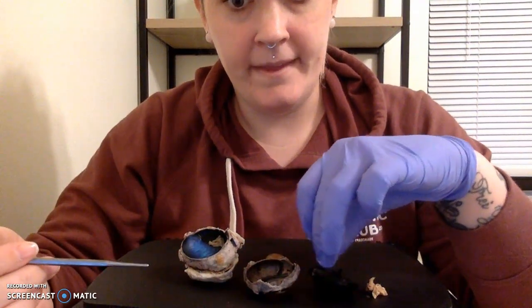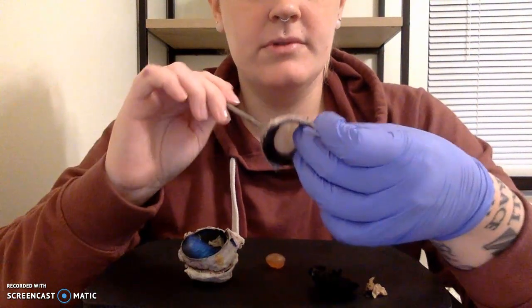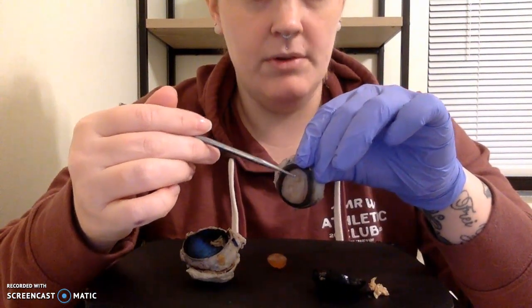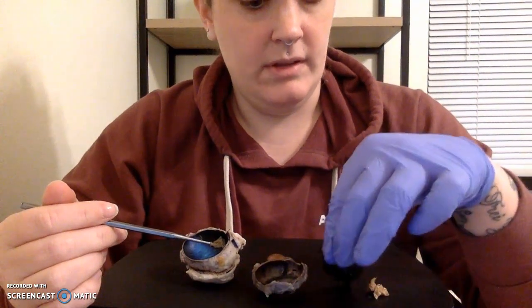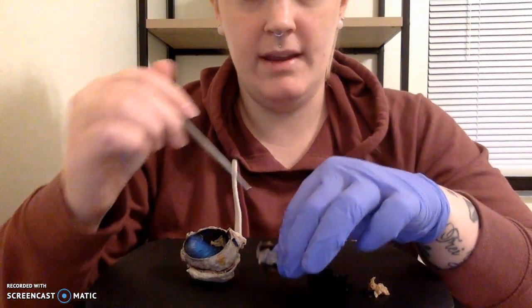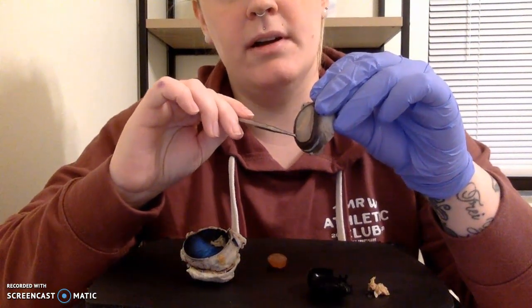And our aqueous humor, I want to say that that was our liquid that was expelled when we cut into our cornea to get a better view of the anterior compartment. That was a liquid that leaked out all over the place onto our paper towel. So I wish I could show you, but I can't. But I can show you where it's located, which is right here on the front of our eye.